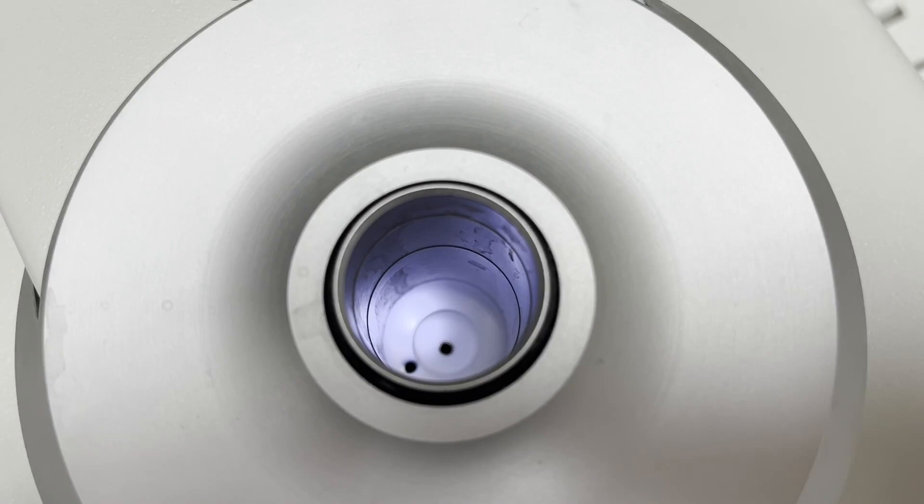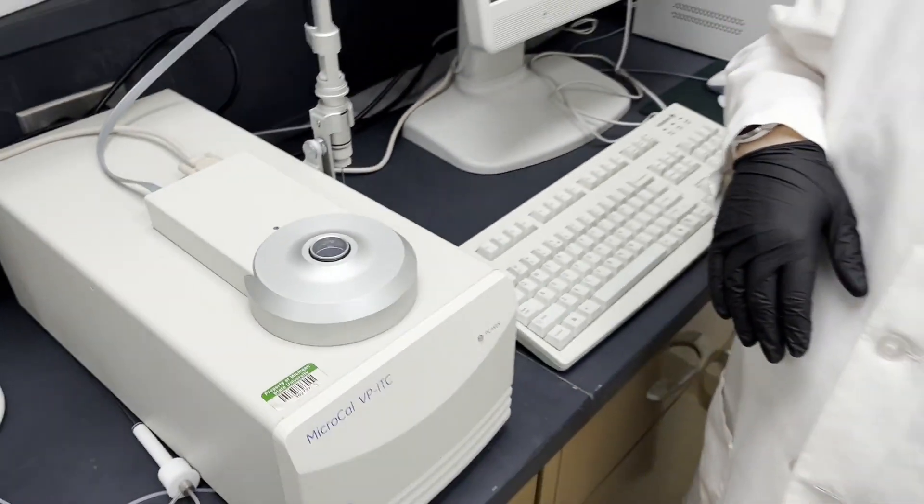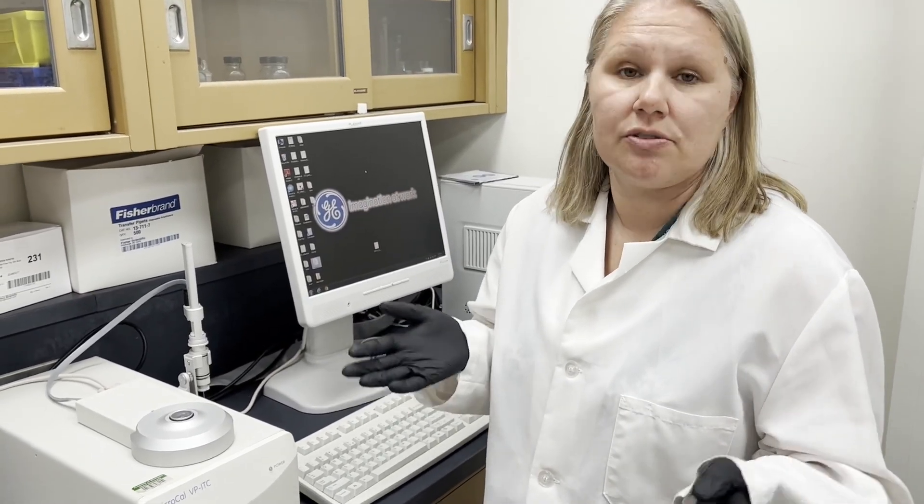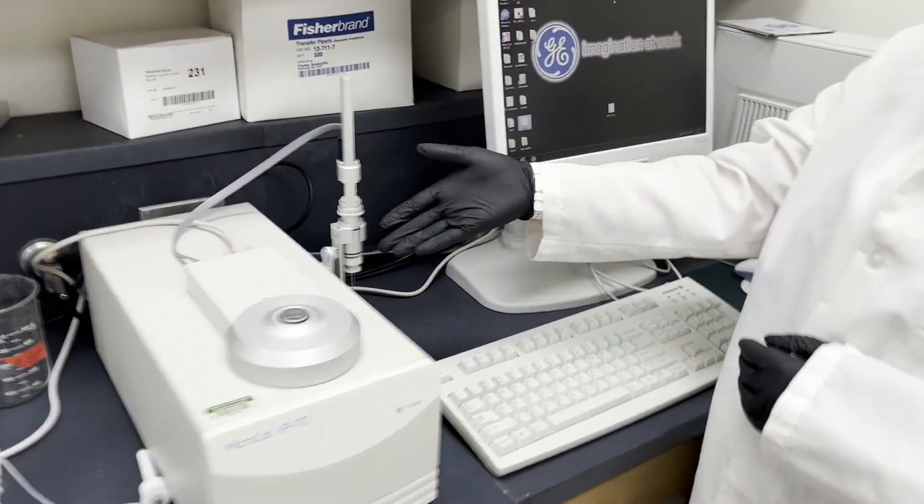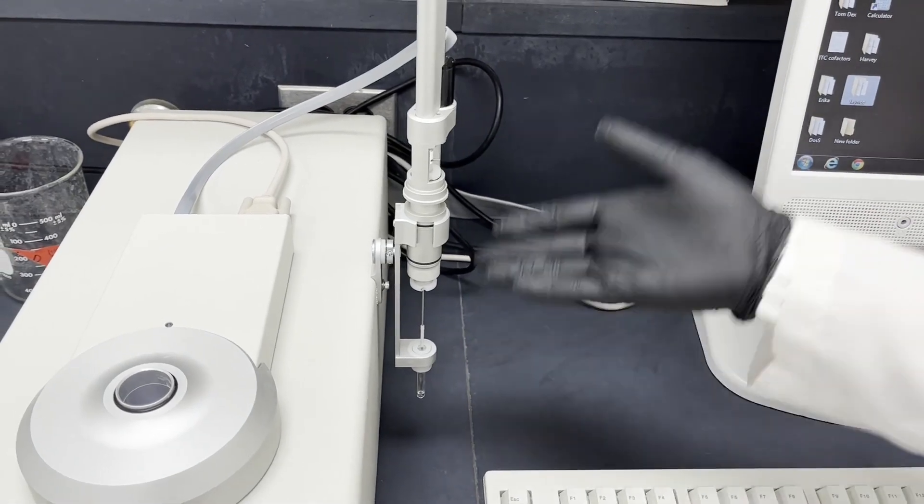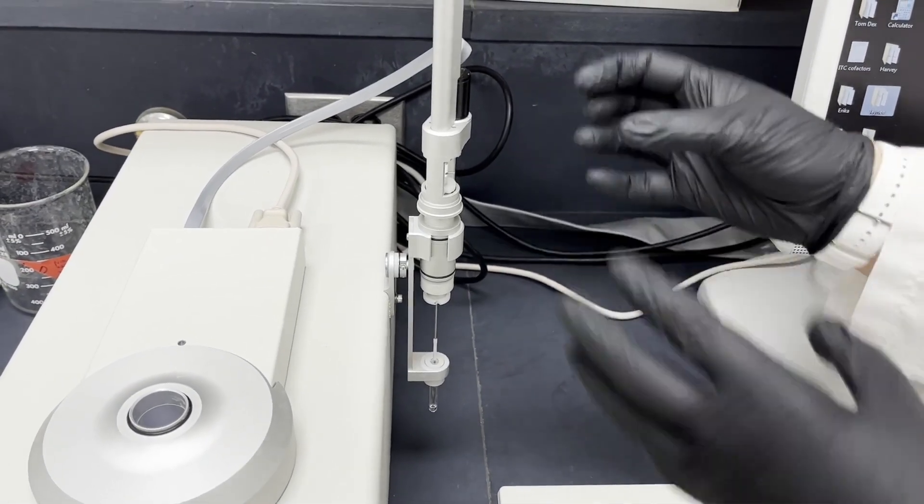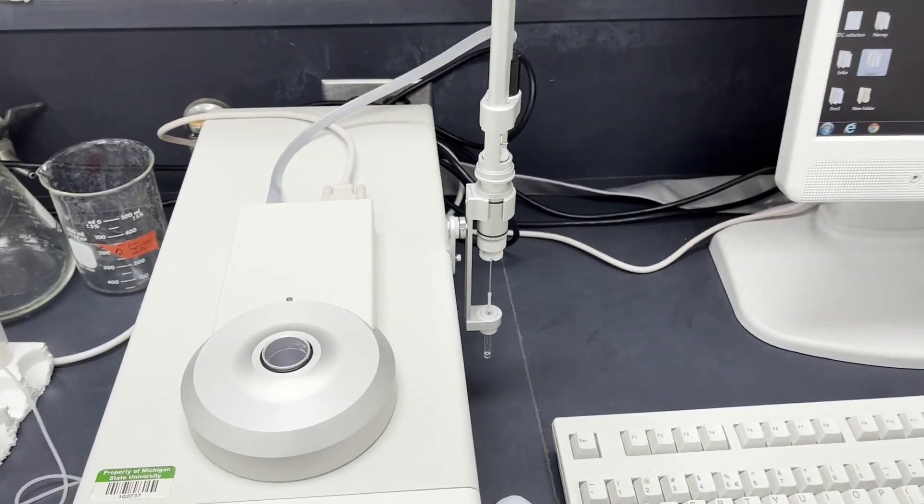And the right is the hole for the sample cell. The volume of the sample cell is about 1.4 milliliters. Honestly I have people make about 2 milliliters of sample if you can. This is the injection titration syringe, and this is where you'll be putting your other sample and then eventually putting this syringe in here and starting the injection process.